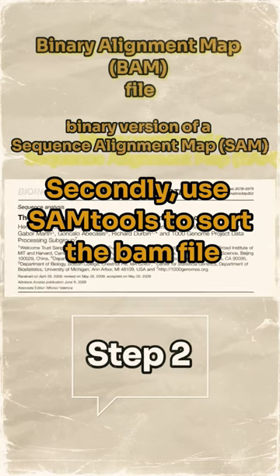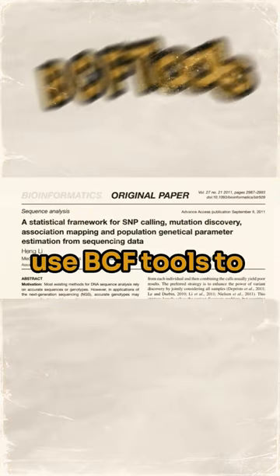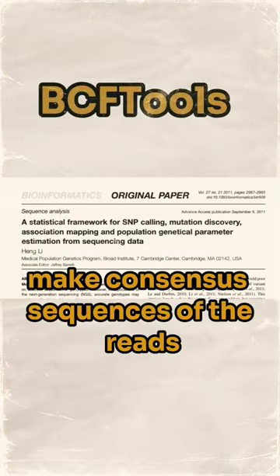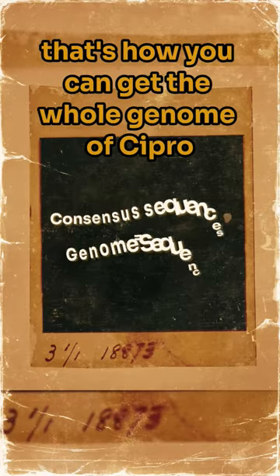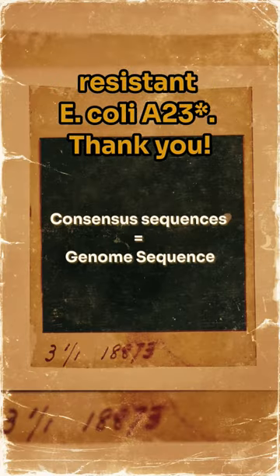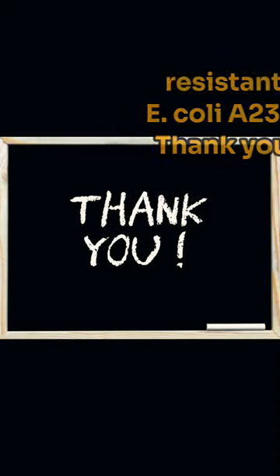Secondly, use SAMtools to sort the BAM file. Then use BCFtools to make consensus sequences of the reads. That's how you can get the whole genome of Cipro-resistant E. coli A23. Thank you.